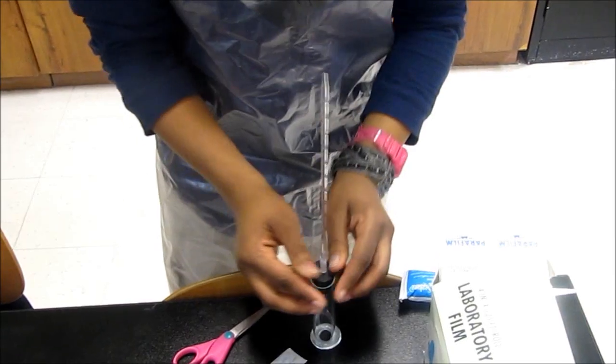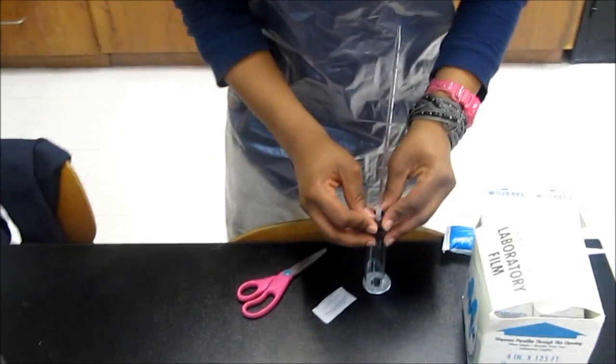Then you take this, you stuff it in airtight, so no air is in.